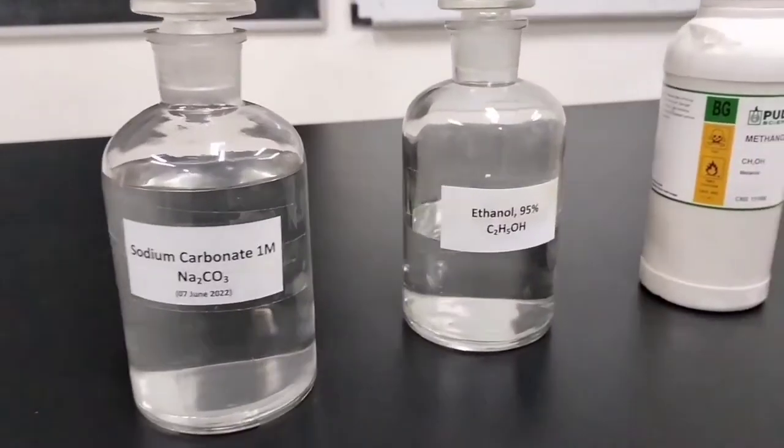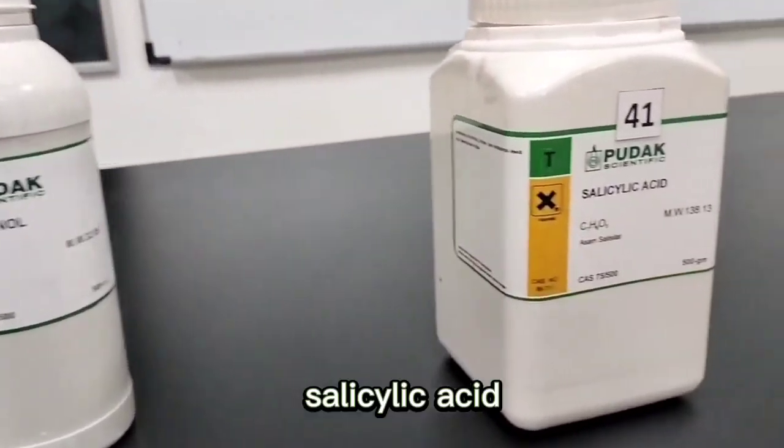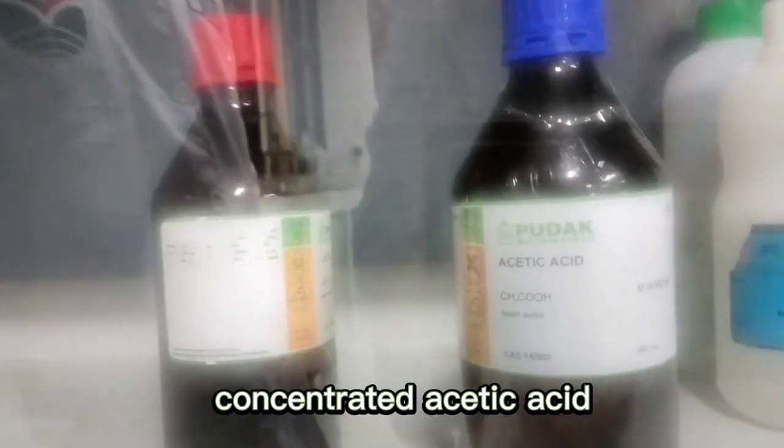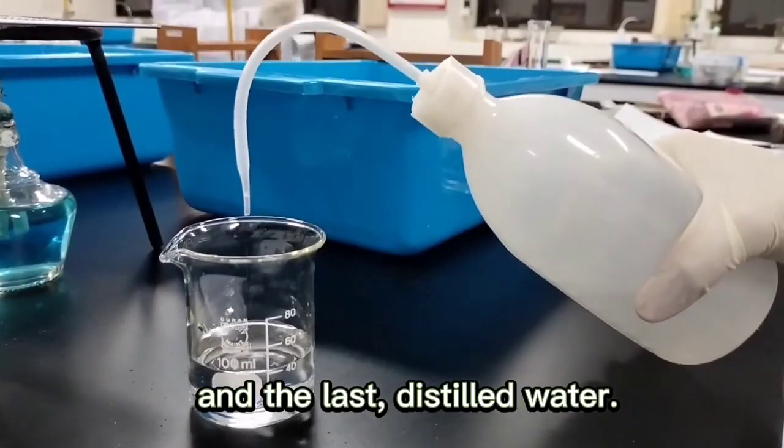For materials, we have sodium carbonate, ethanol, methanol, salicylic acid, concentrated acetic acid, concentrated sulfuric acid, and the last distilled water.